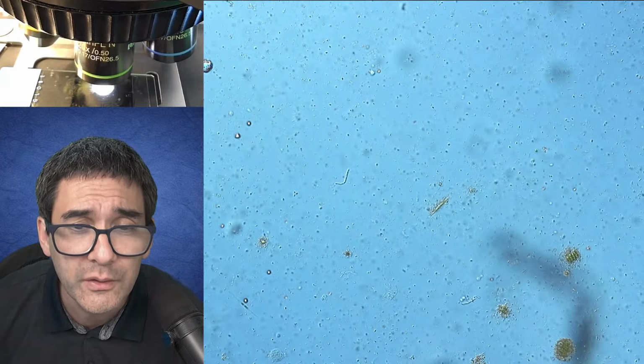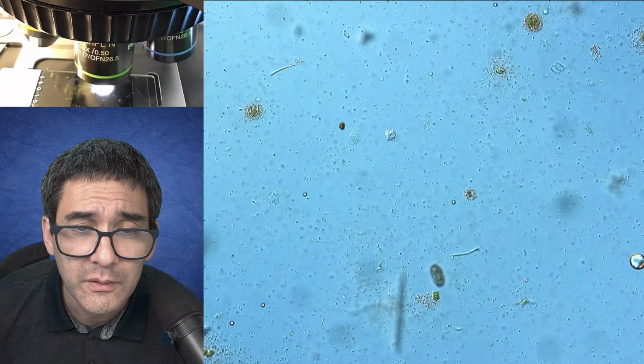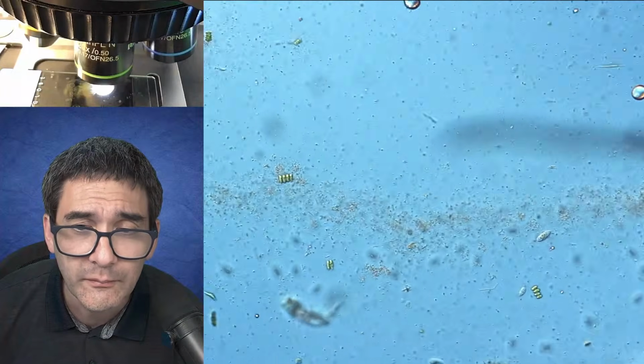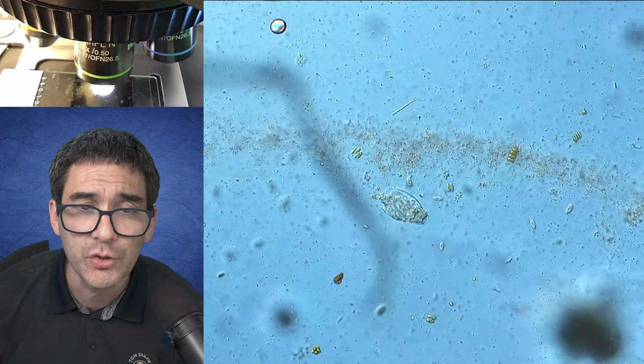Look, this one over here. What else is there? Oh, yes. This is also quite common. Very common as well. Let's be a little bit patient now.